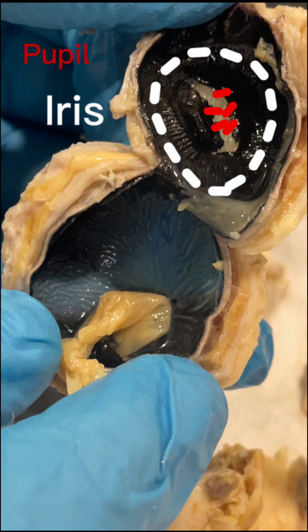Muscles in your iris control your pupil. When your pupil is wider, dilated, more light gets into your eye. When it's narrow, contracted, less light gets in. As your iris squeezes or releases your pupil, the amount of light that reaches the rest of your eye changes.